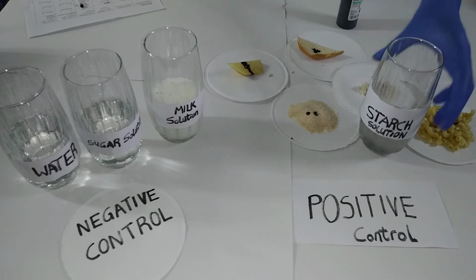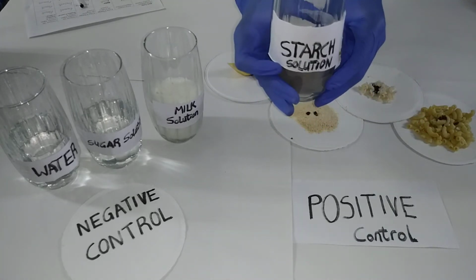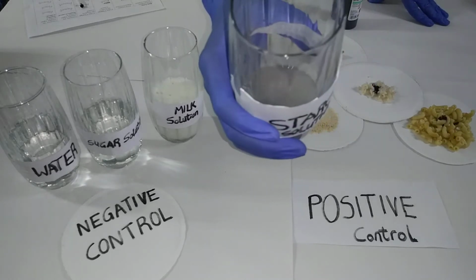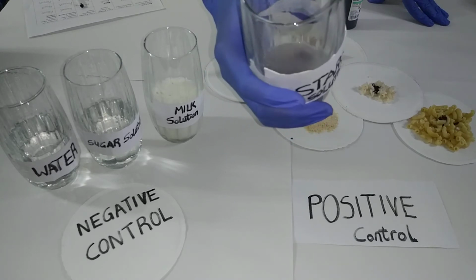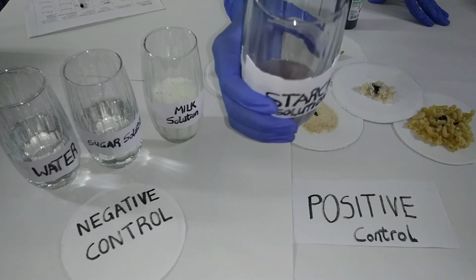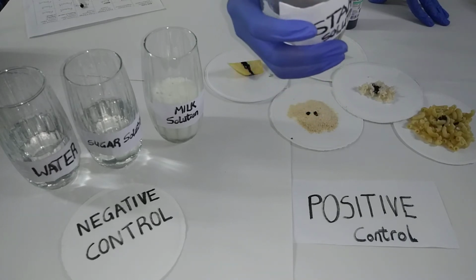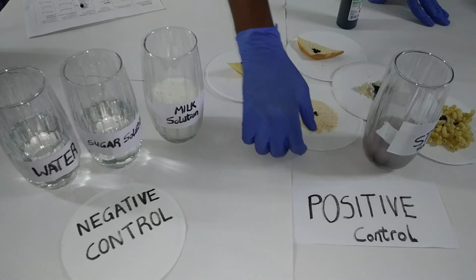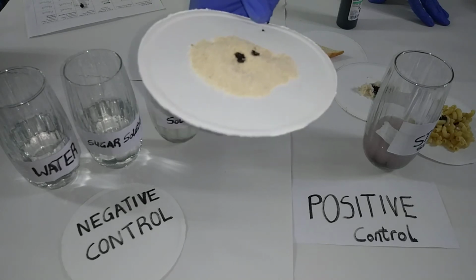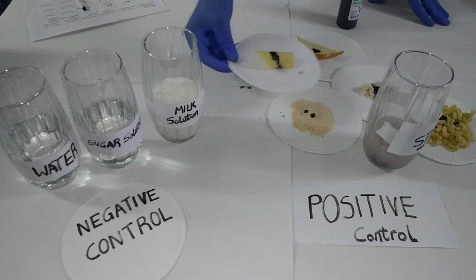So for the positive control group, as you can see, this is starch solution, and when I added a few drops of iodine, you can see it's changing from brown to bluish black, or let me just say deep blue. So the solution is turning to deep blue. For this, which is cassava flakes, as you can see, it's turning black, and that shows that there is a polysaccharide called starch in that food sample.